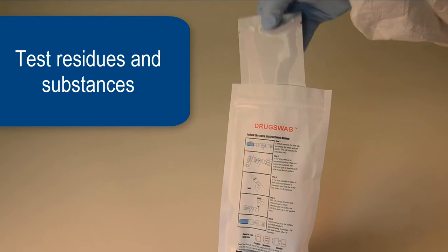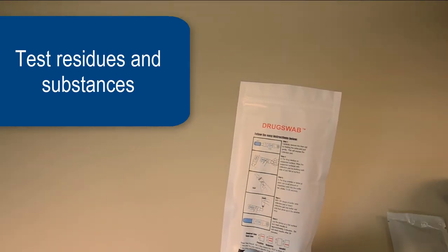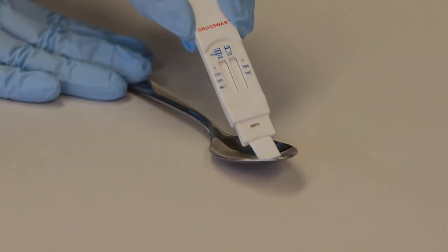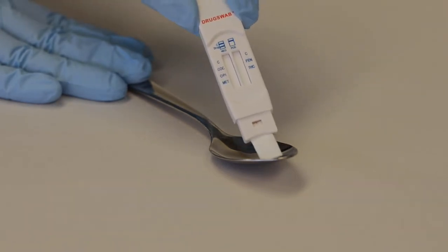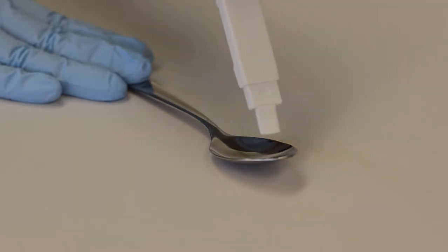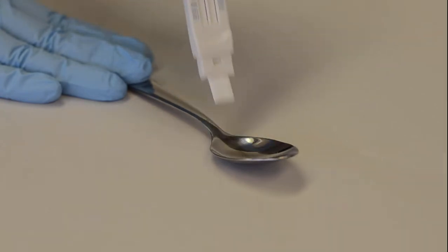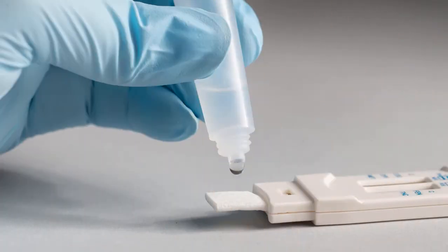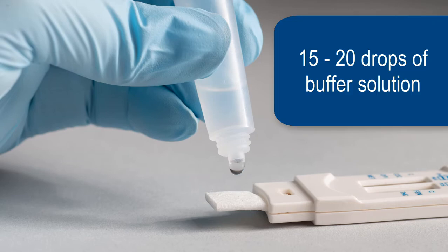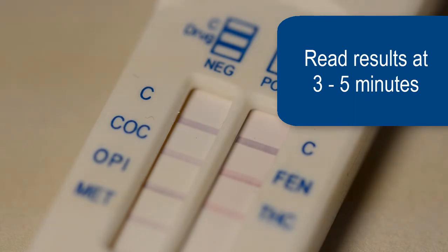There are two safe and easy ways to test residues and substances. To test suspected drug residues, wipe the suspected area with the collection pad by pushing both sides of the pad flat onto the surface. Lay the test on a flat surface and add 15 to 20 drops of the buffer solution onto the collection pad. Wait three to five minutes before reading results.